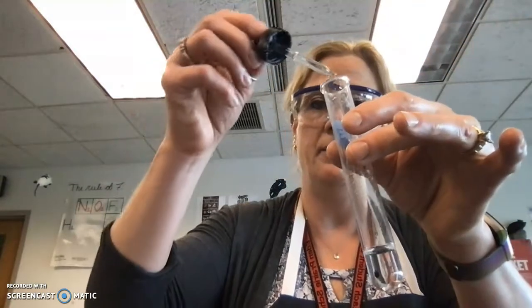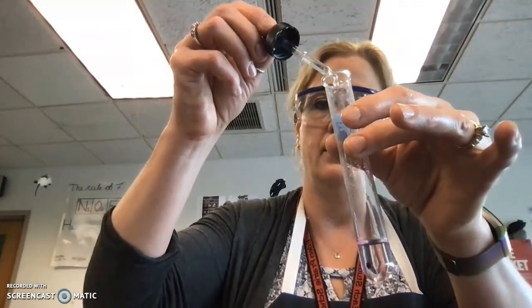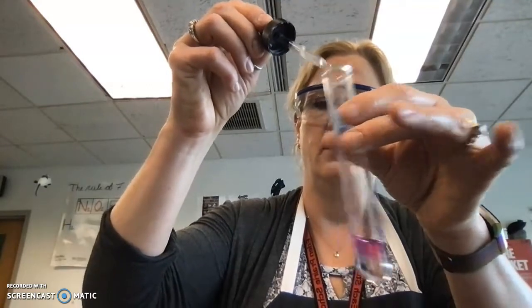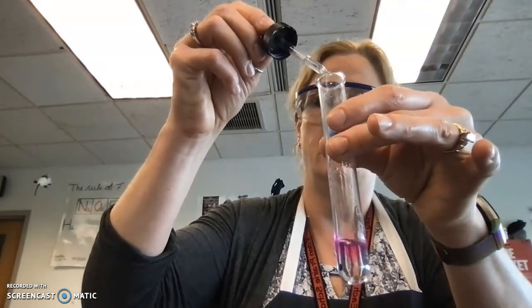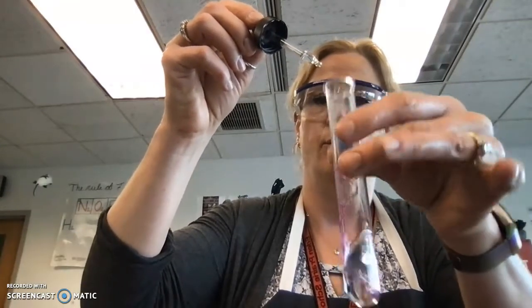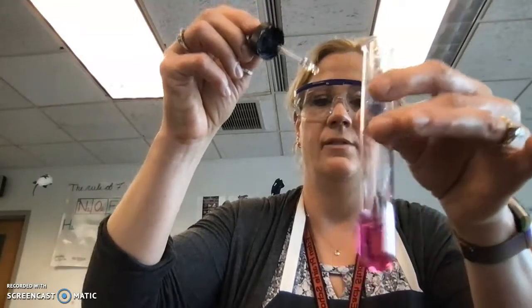Okay, so I'm at 15 where I was for the previous trial, but now I'm going to count again. 16, 17, 18, 19, 20, 21, 22, 23, 24. Ooh, almost. 25. There we go. So 25, not quite double. So for the third entry, 25 drops.